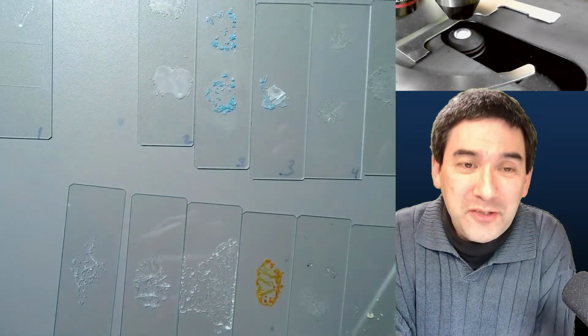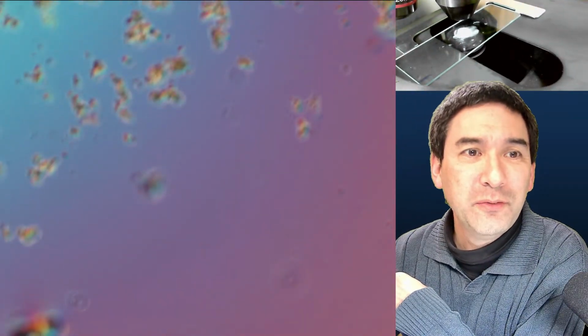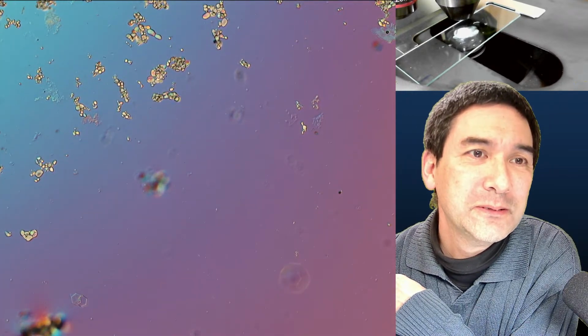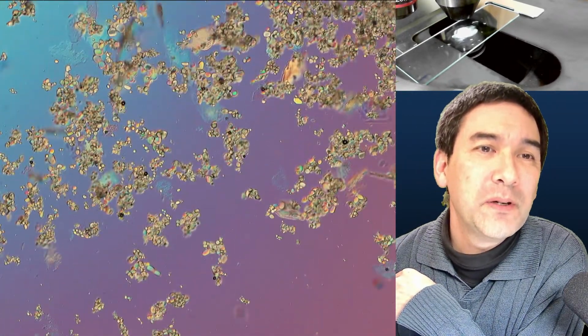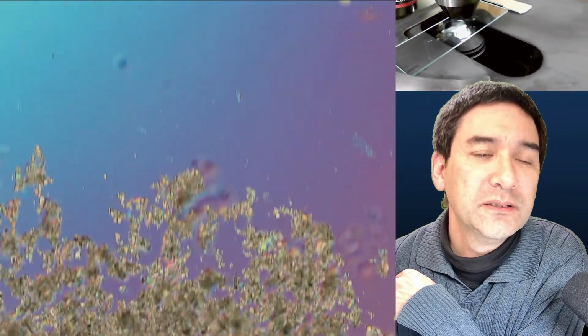But I'm going to show this to you now again, because after just a couple of minutes, it was quite surprising. You still do see crystals, of course, but let me see, where are they? I need to refocus again. Here we go. Yeah, here are some of these crystals, but there was some somewhere on the other side here.